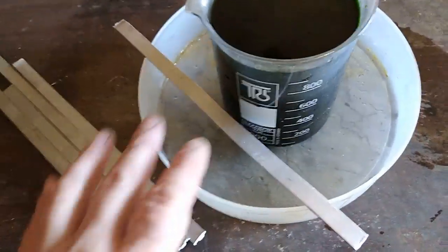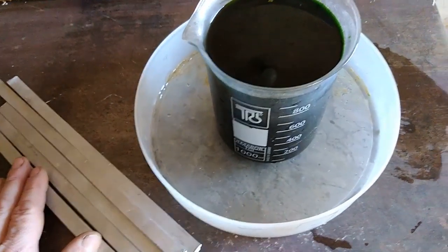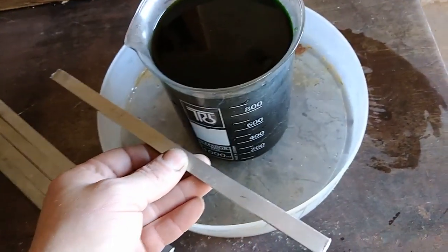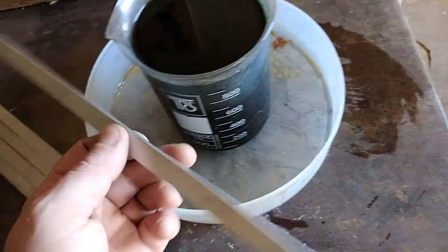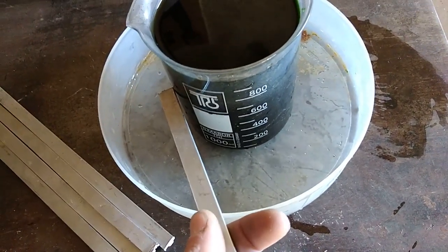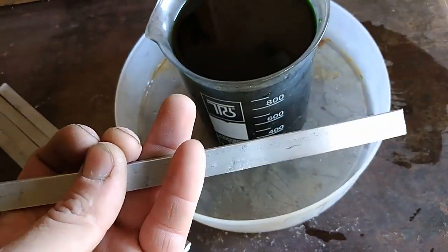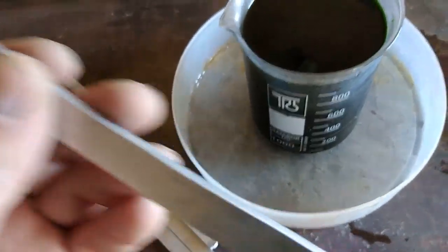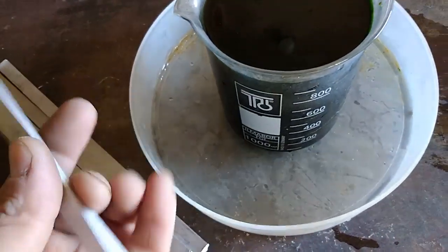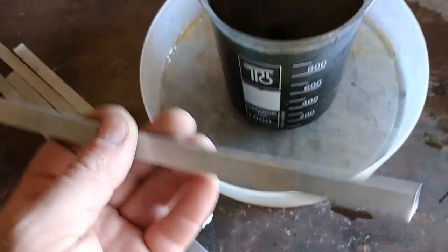So this is not the best way for a perfect solution. But for the purpose of this video, we will do it this time just to see what happens and how it looks, because it's a very, very fast process and in half an hour you can get all the copper out of the solution. This is also not the cheapest process because iron is cheap and aluminum — especially this clean aluminum — is not that cheap. But copper is about $5 here in Serbia and aluminum is about $1 at the junkyard, so you still make some money. For me, it's never been a good way to use aluminum for this because I have time. If you use iron pipes, iron is about $0.10 to $0.20 per kilogram, so it's much, much cheaper.